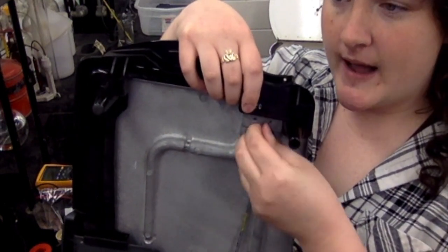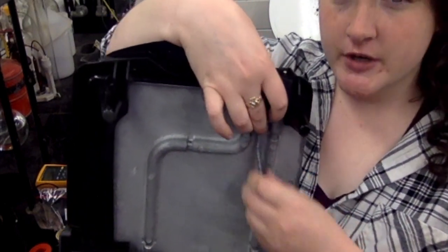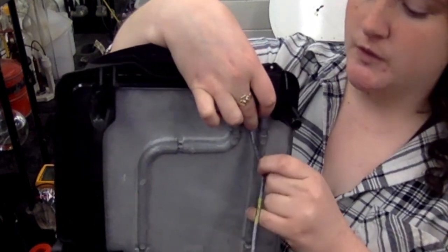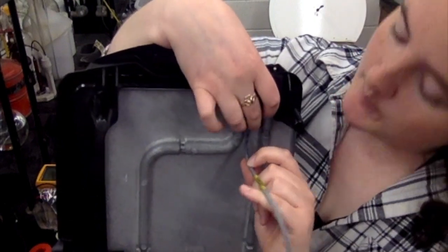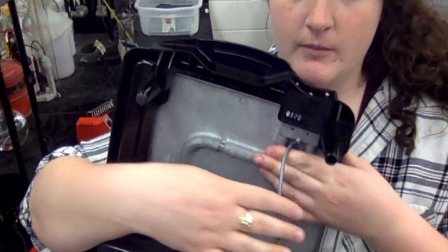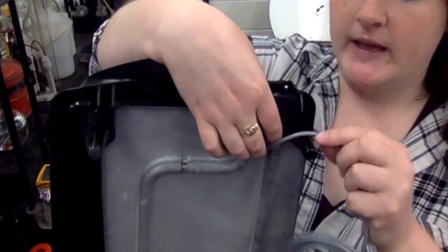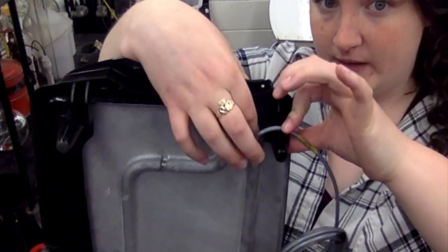And the last thing that we need to do is to ensure that this wire is not going to interfere with these heating elements, because if this is up against this heating element, it's going to melt the wire, which is no good. There's 2 different ways you can do that. You could put an asbestos pad under here like this, and then it's going to keep it from touching both sides. Another way, and I think kind of my preferred way, would be to use the leg here. You can drill a hole in the leg and then put a zip tie through the hole and kind of pin this here like that.